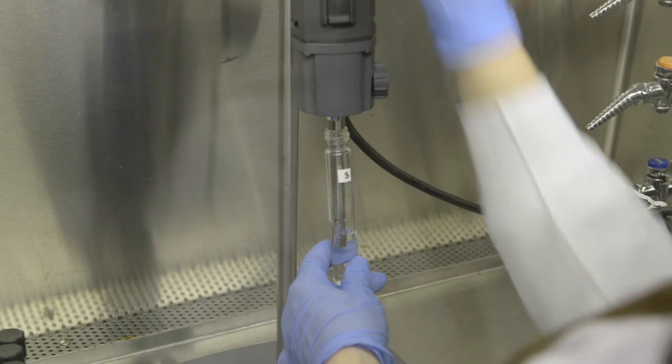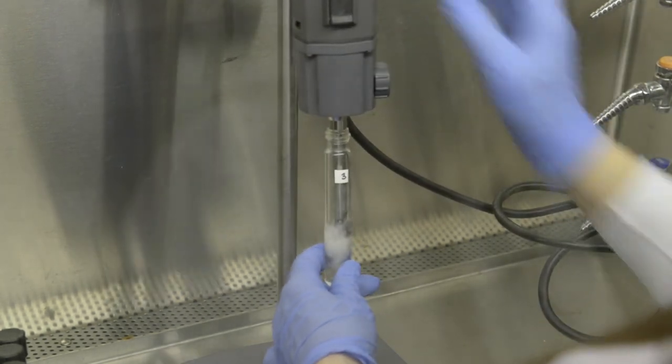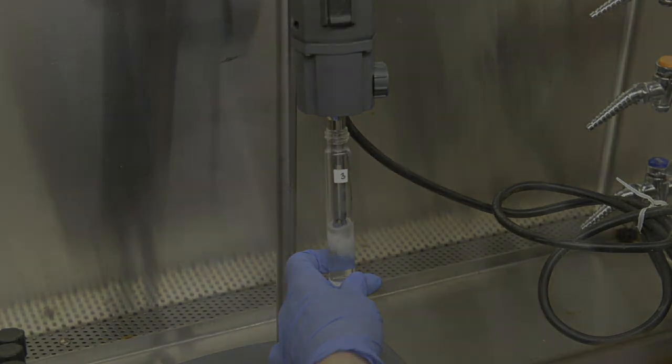The disaggregated biofilm sample is ready for serial dilutions. Enumerate viable cells using the drop plate or other appropriate plating method.